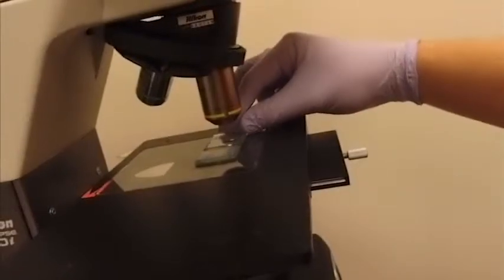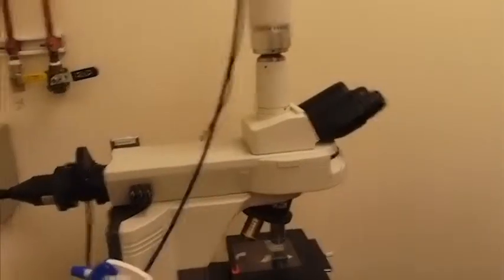A diluted mixture of cells is placed on a hemocytometer, which is viewed in a microscope. The dots on the screen are individual cells. They are counted and multiplied by the volume and dilution factor to give the total number of cells in the culture. I hope you enjoyed learning about my research project.